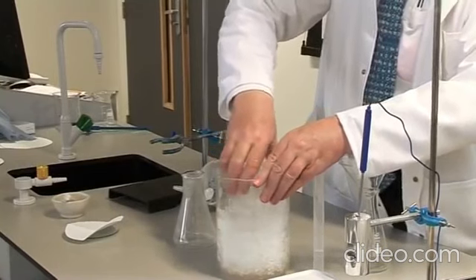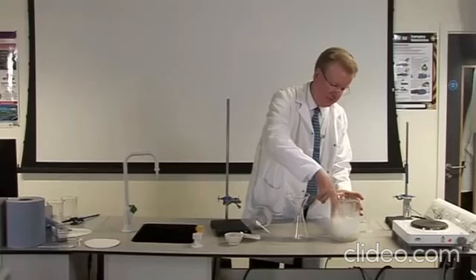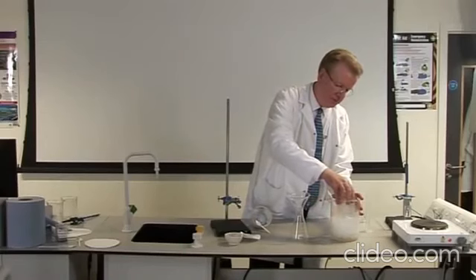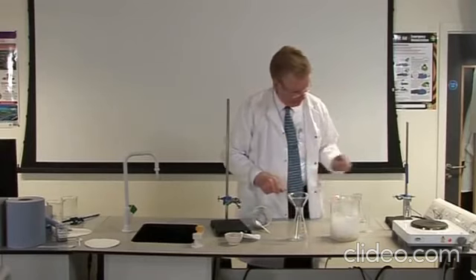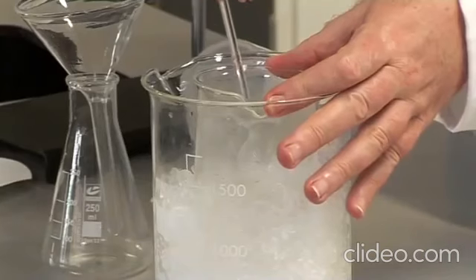On allowing the hot solution, called the filtrate, to cool, crystallization takes place and crystals of pure benzoic acid are formed. If these crystals are slow to form, scratching the inside of the beaker with a glass rod speeds up the crystallization process.